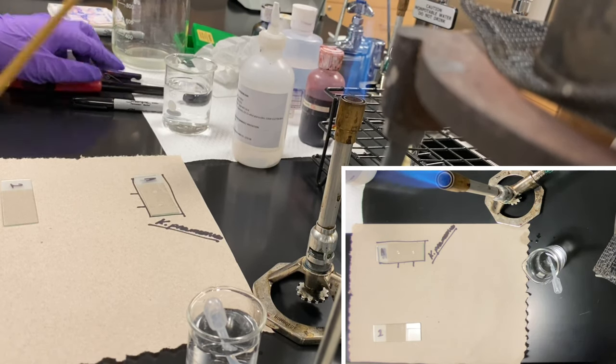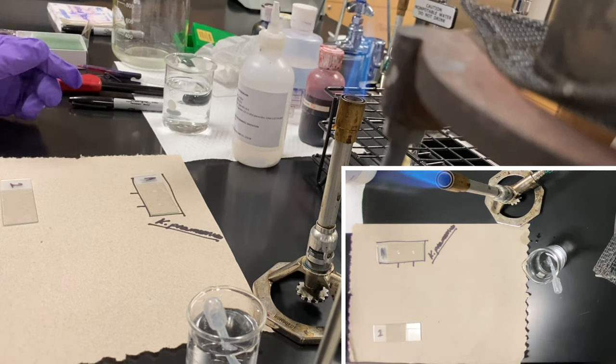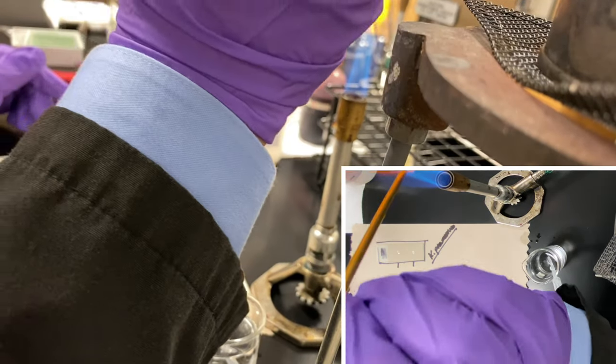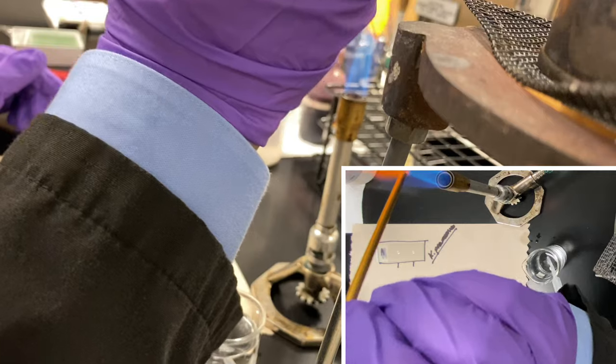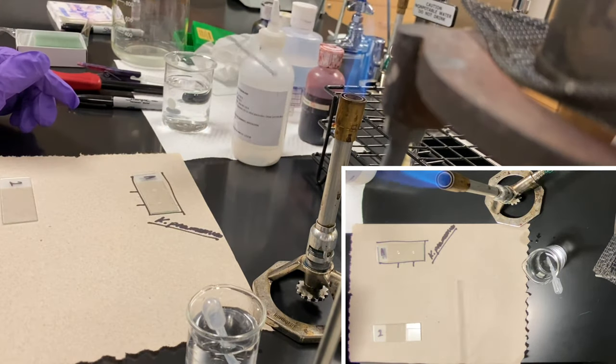Taking my loop at a 45 degree angle with my elbow. Go in, out, in, out. Sterilize this.